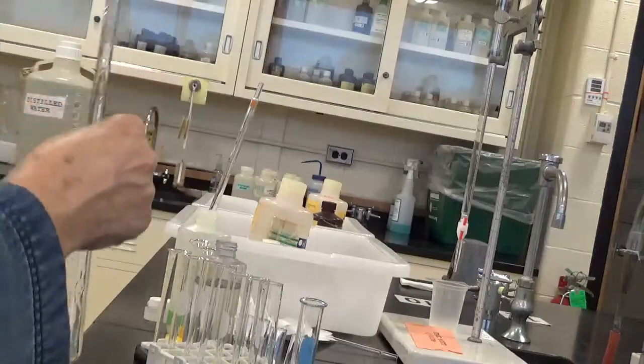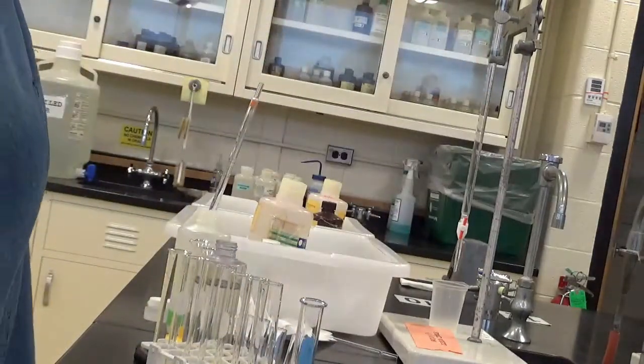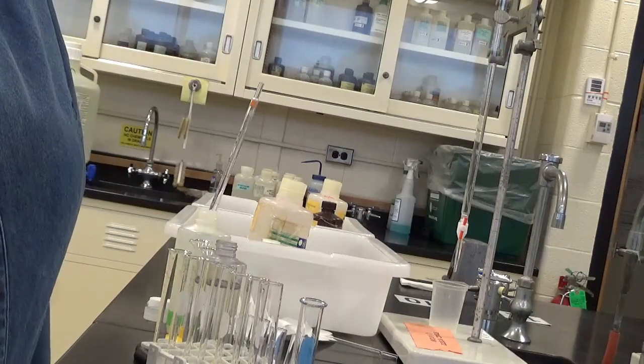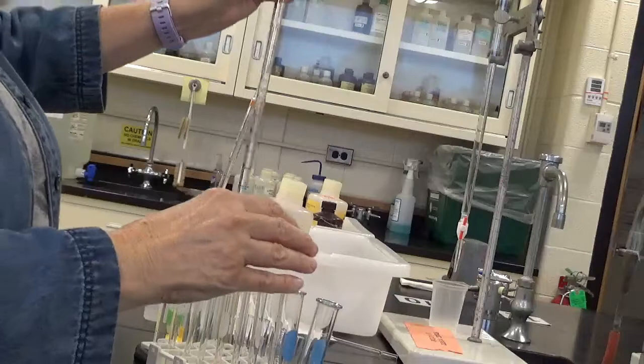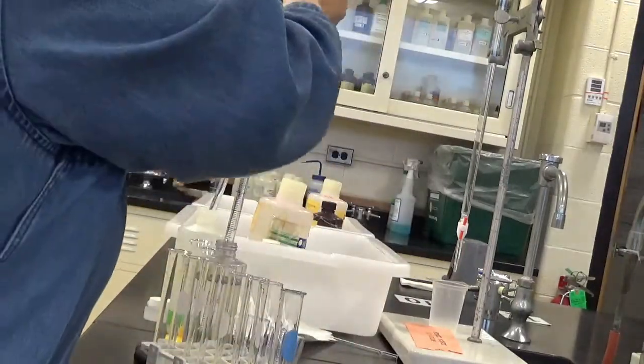That's a little drippy. 5, 6, 7, 8. And finally 9 and the last one.